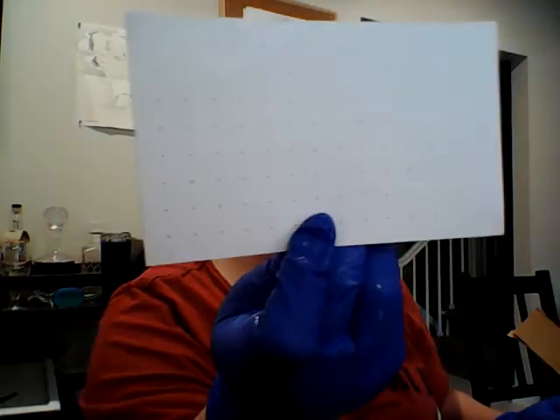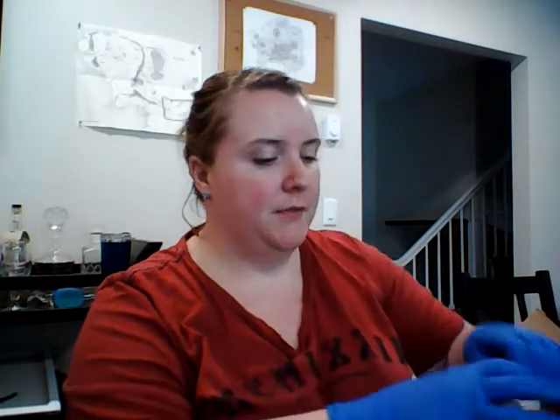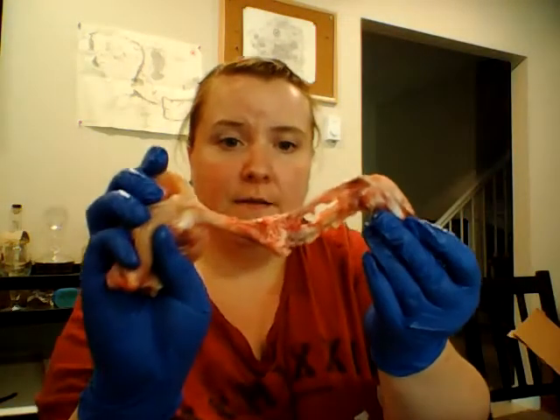And then I have my note card and the back. So today I dissected a chicken wing. So here's the results of that.